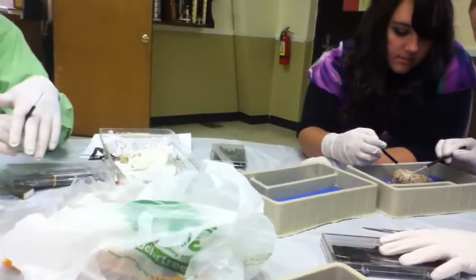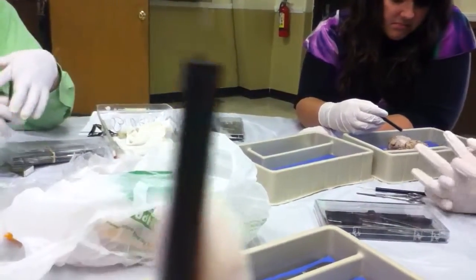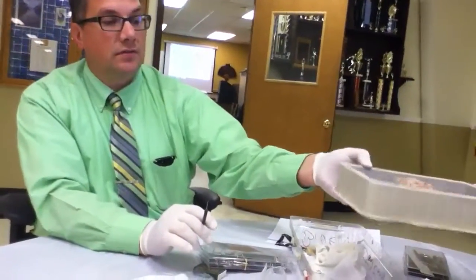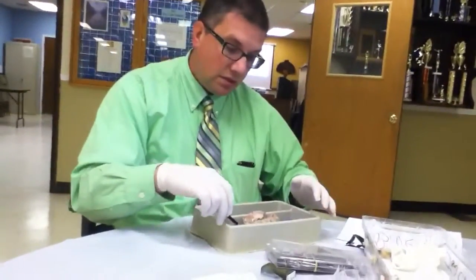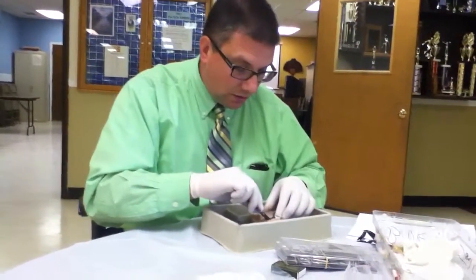So what we're going to do is everybody's going to get a whole hemisphere. And then we'll do the cerebellum in a minute. So the cerebrum is two hemispheres, correct? Correct. So we have two hemispheres and then we have the cerebellum — all do different things. We'll cover that in just a minute, what each one of them does.